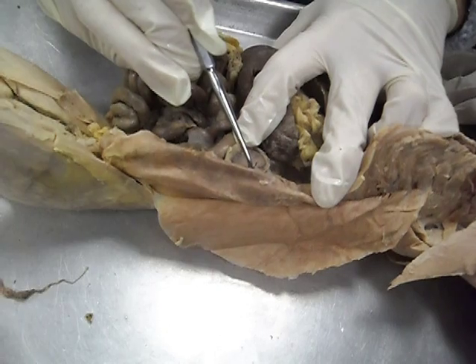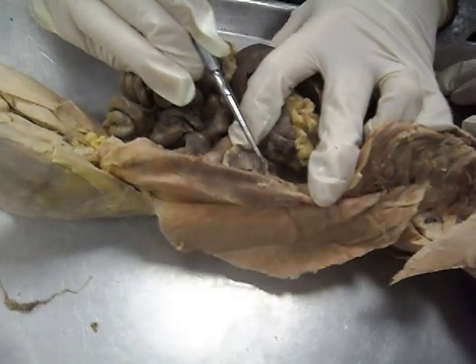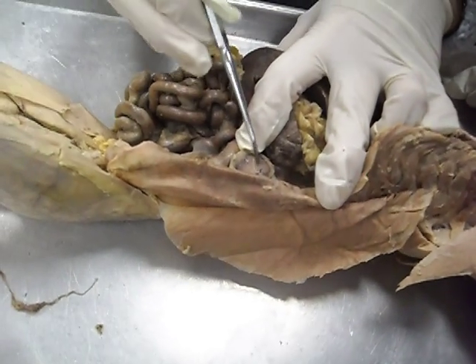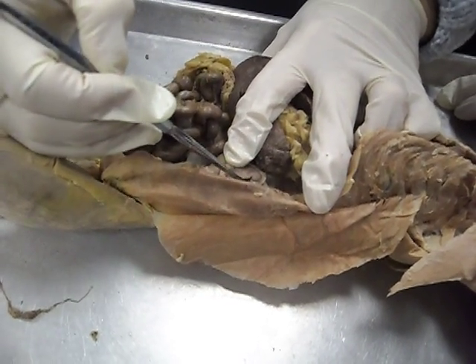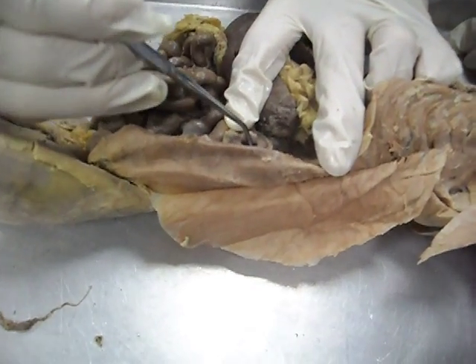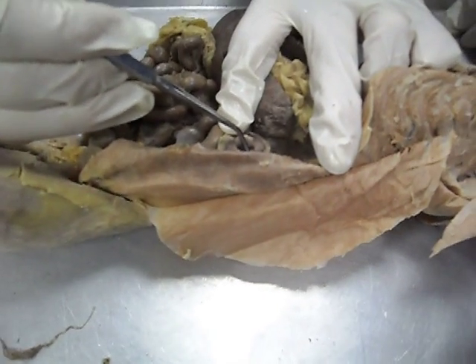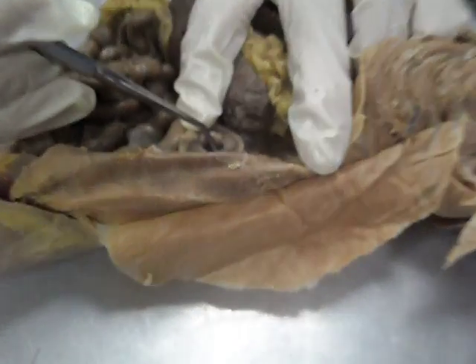Columns are not as discrete in this particular dissection, but this central open area is the renal pelvis. There's your renal pelvis right there.